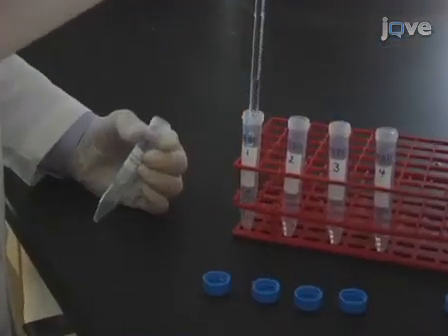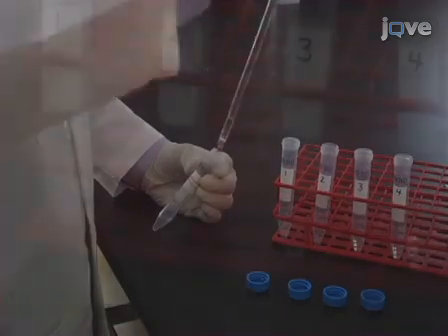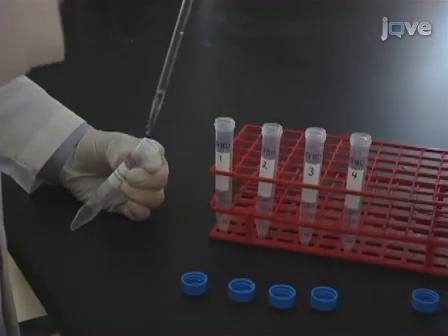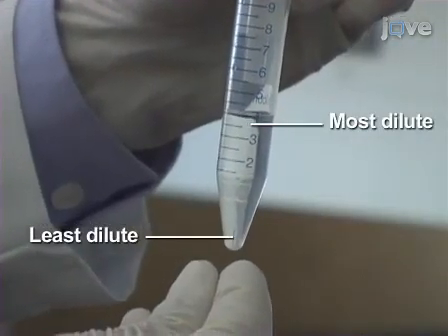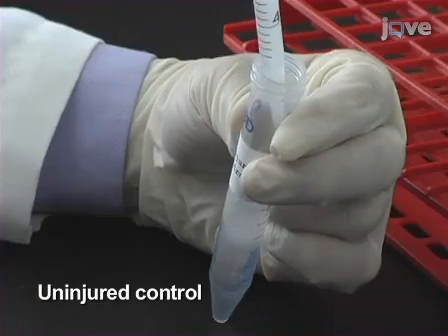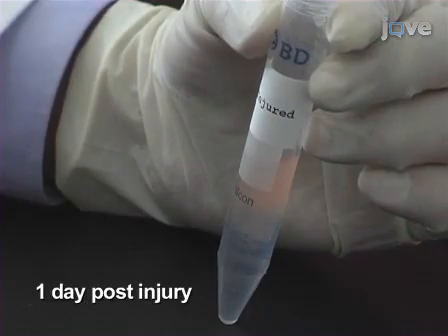Now, slowly and carefully place the full 1 milliliter of each of the 4 solutions in layers in a 15 milliliter conical tube with the least dilute on the bottom and the most dilute on the top. Then carefully layer the 6 milliliters of dissociated spinal cells in HBSS, both uninjured control and contusion-injured sample, on top of the OptiPrep gradient solutions.